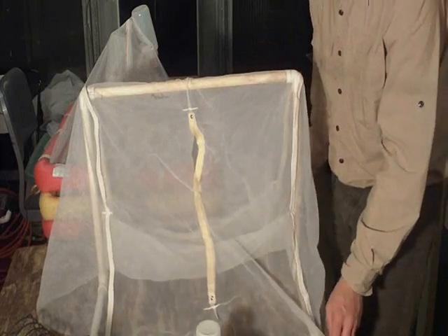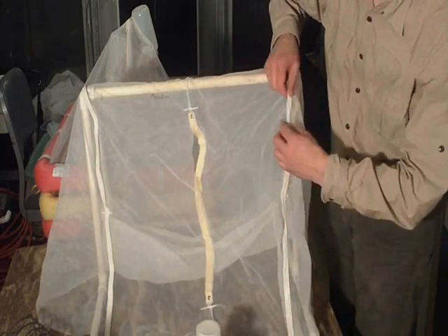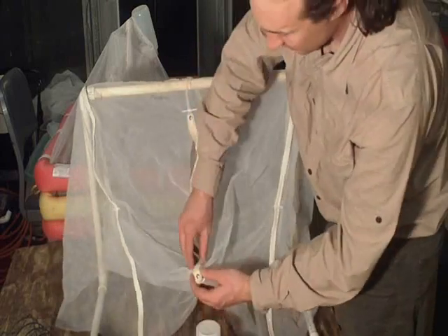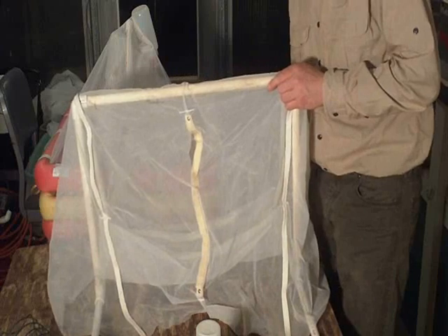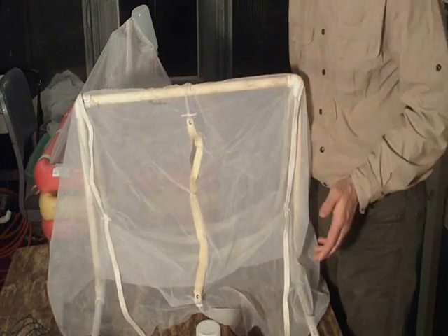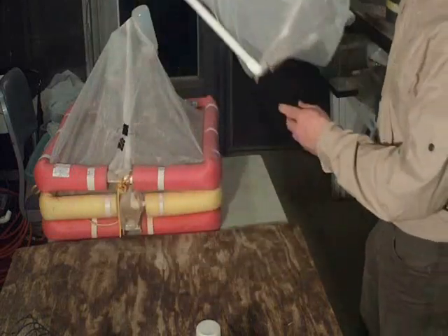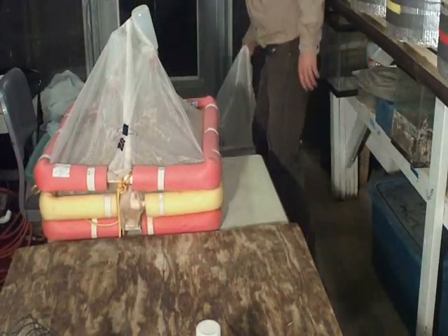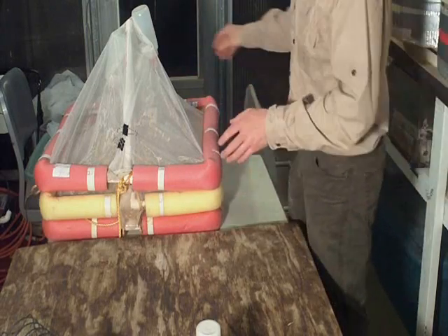So I opted against this. The other reason I opted against it, I mean, it's beautiful. It's well sewn and it's got a little Velcro entry. But man, the amount of time and money that went into this, if I lost them, I would start crying. I wanted something that was going to be cheap and was going to be under $10. Certainly couldn't afford those crazy BioQuip $300 or $200 ones. So we came up with this.